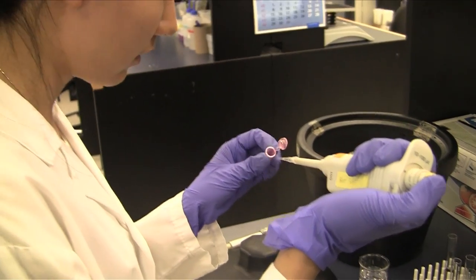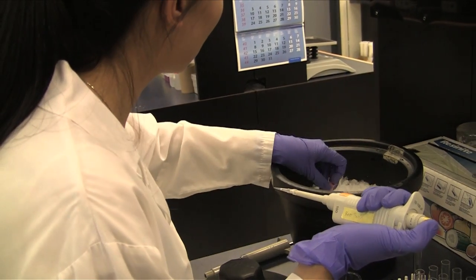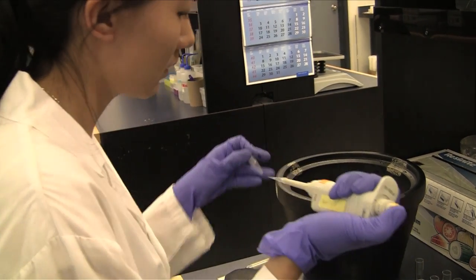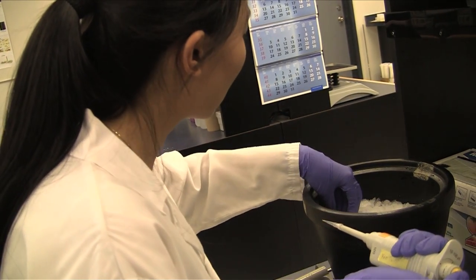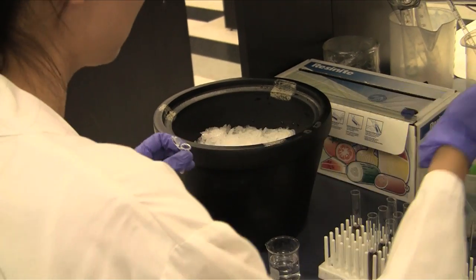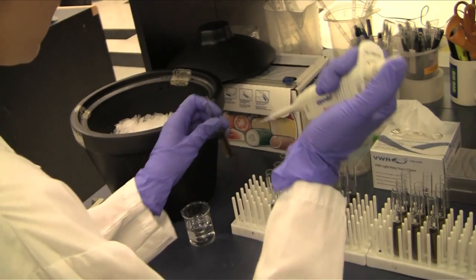Prepare a series of protein standards in duplicate and dilute with phosphate buffered saline or PBS so that the final concentrations are from 0.1 milligram per mil to 1 milligram per mil.